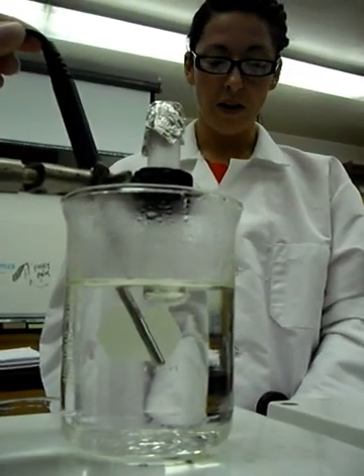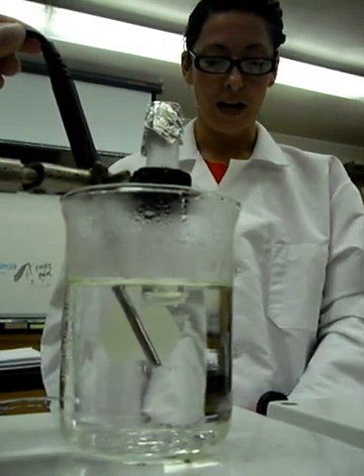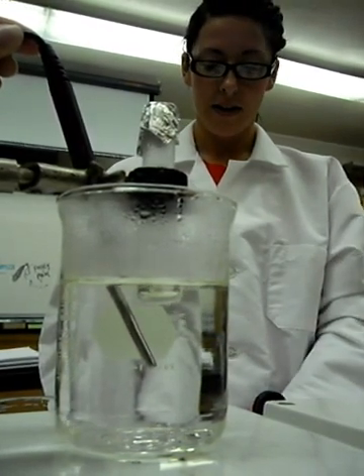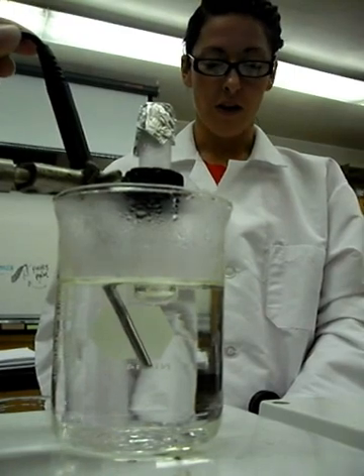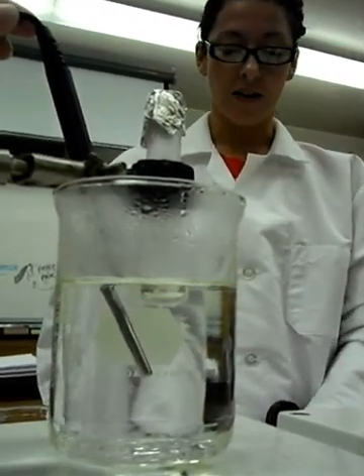Keep the test tube in the boiling water bath for at least 3 minutes until all the liquid in the test tube has vaporized. Record the temperature of the boiling water bath which will be used in the ideal gas law calculation.